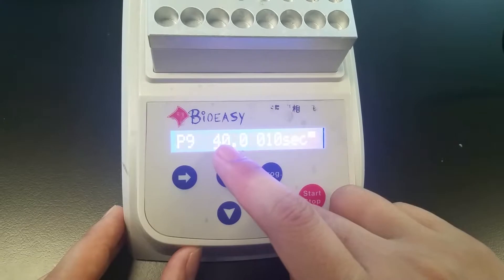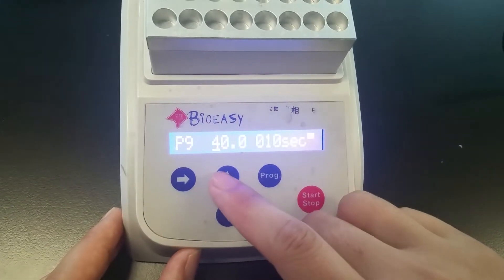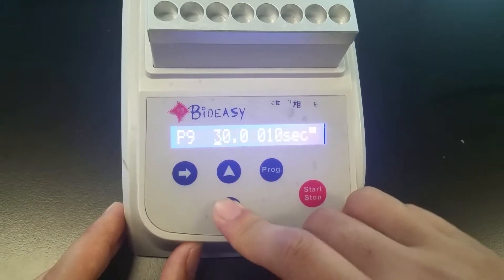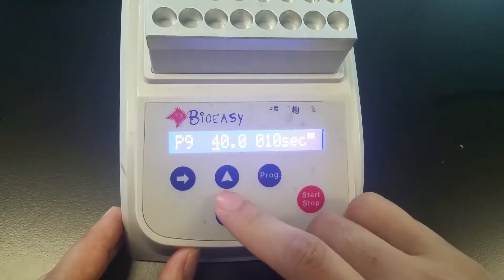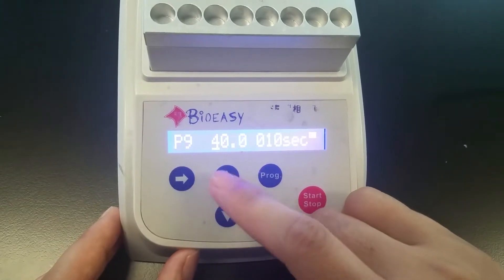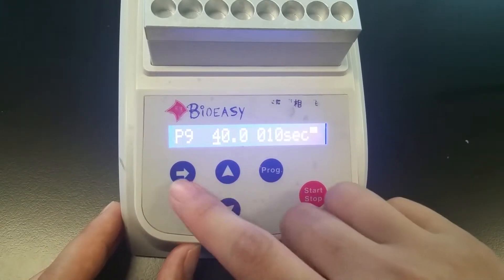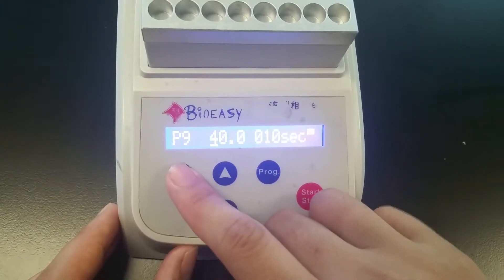It means the temperature. We can press the up and down button to adjust the temperature. So now it's 40. We can press the left button further.